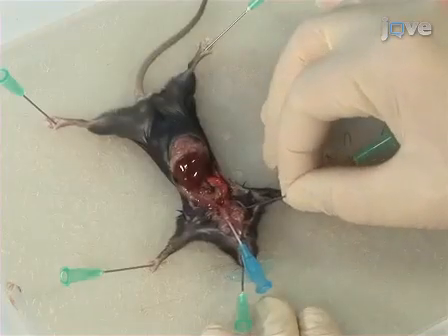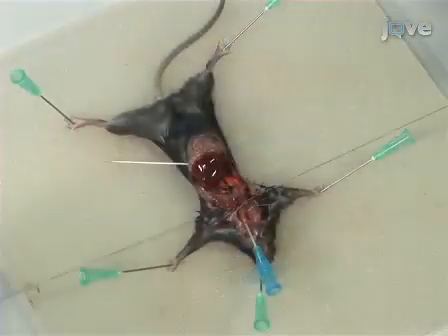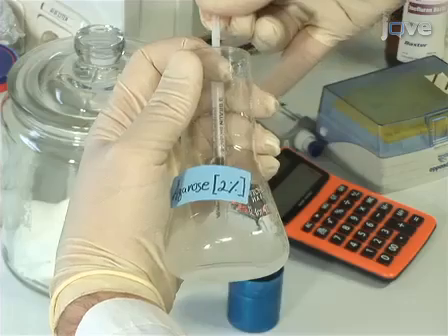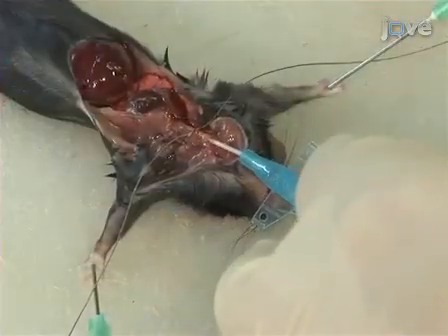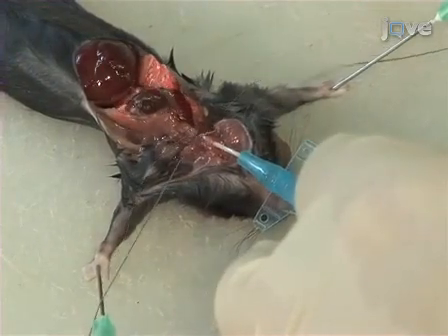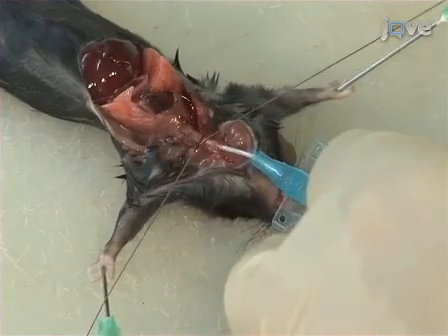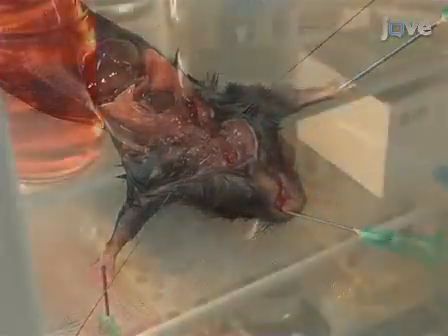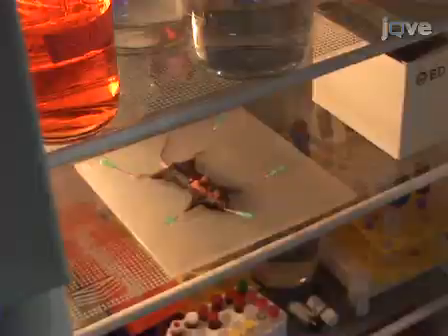Using a sewing needle, a standard sewing thread is layered around the trachea as preparation for the subsequent agarose filling step of the lung. Next, fill a 1 milliliter syringe with the pre-warmed agarose and administer the solution through the catheter to fill the lungs with it. As soon as the lungs are filled, tie the trachea closed with the prepared sewing thread while removing the catheter, and put the whole animal into a refrigerator at 4 degrees Celsius for 15 minutes.